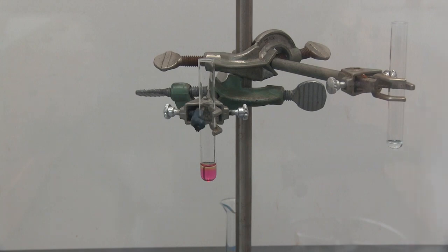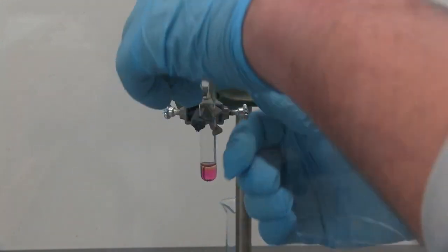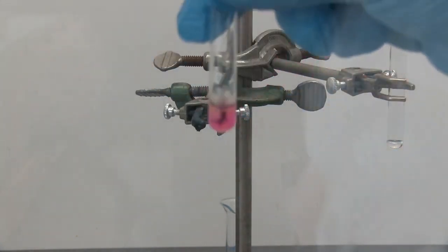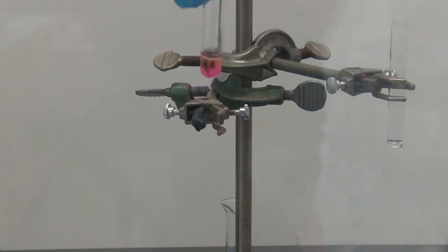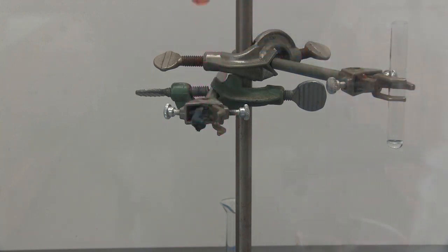I'm going to try the bromine test one more time, and we'll see if we get a positive result on it. But I'm going to bring it closer to the camera. As you can see, there is a layer that's formed that has a brownish yellow. And if we shake it, the entire solution becomes a yellowish color.